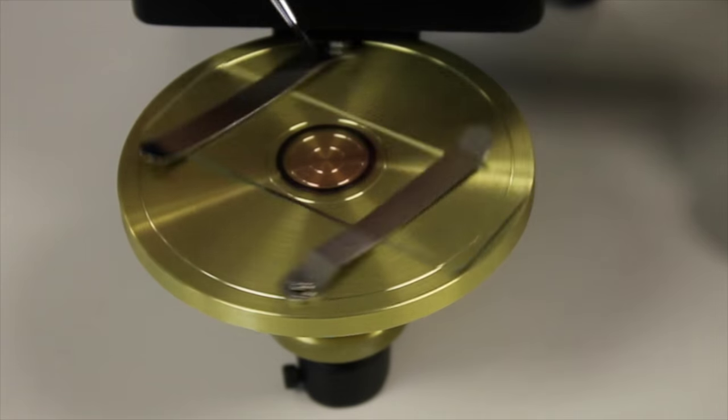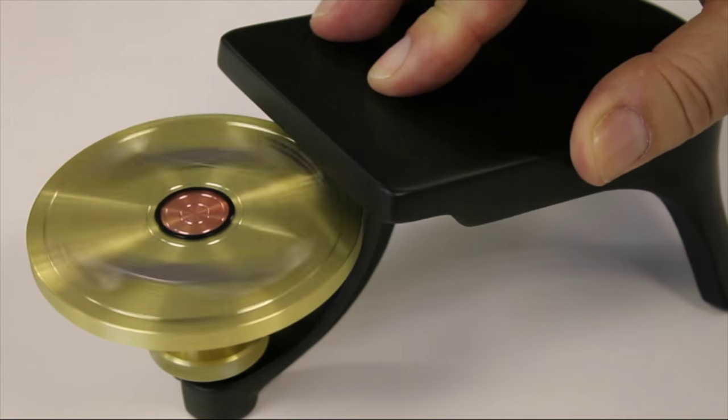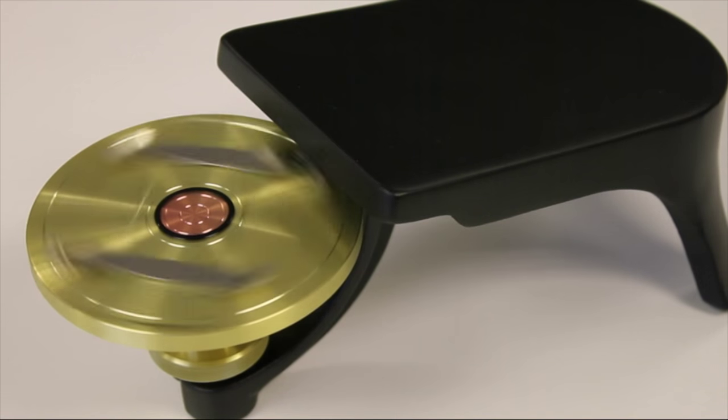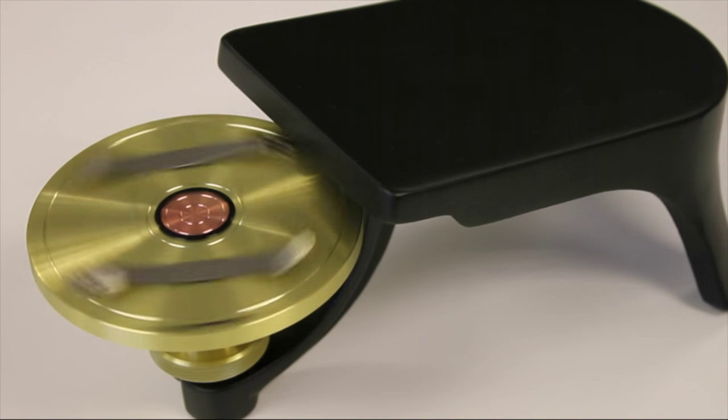Keep the brush perfectly still until the ring is deep enough. Ensure that the ring covers both the edge of the coverslip and part of the slide to complete the seal.